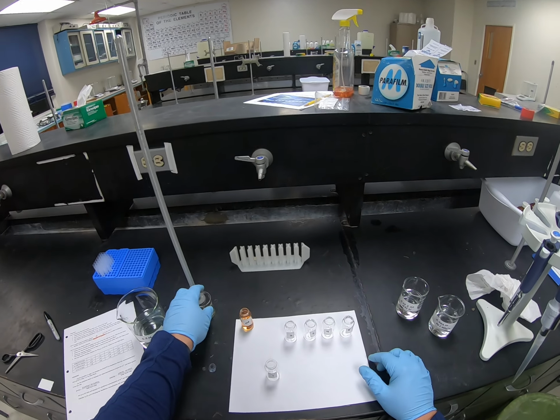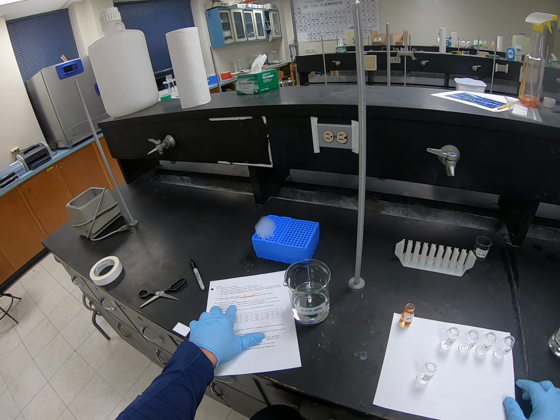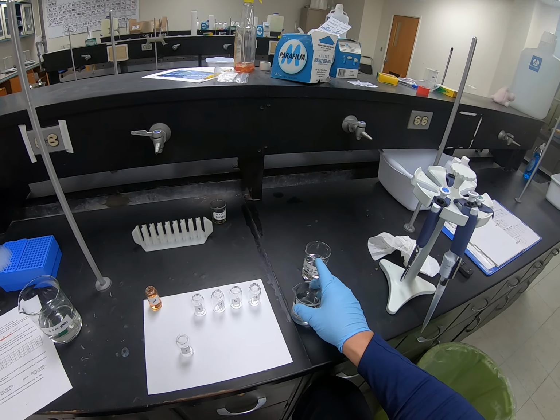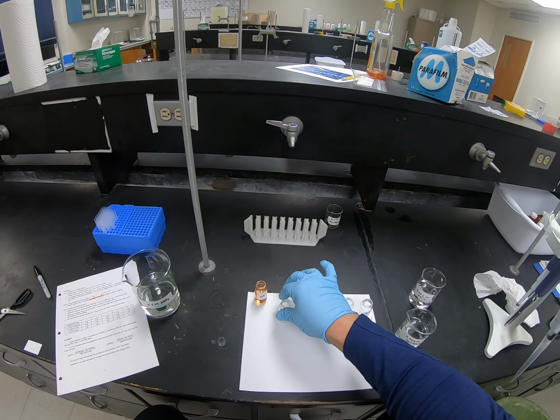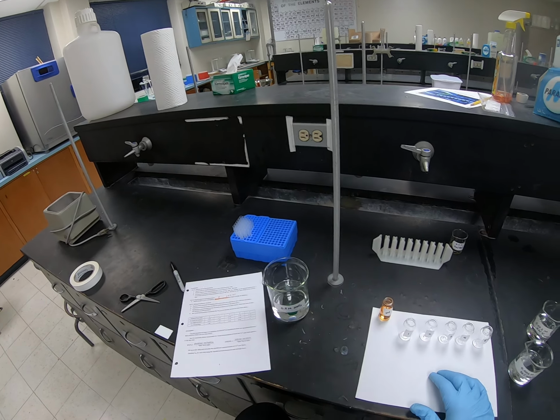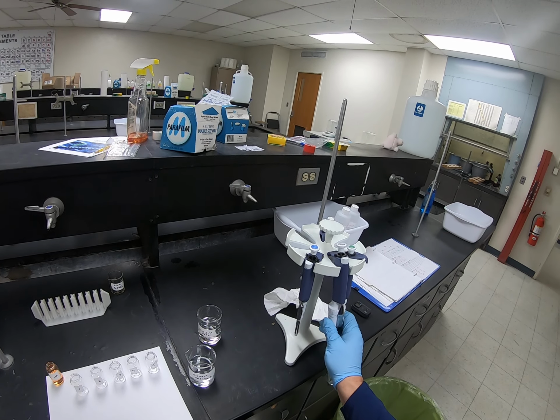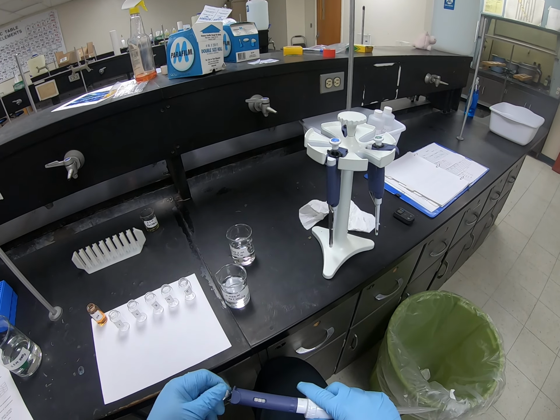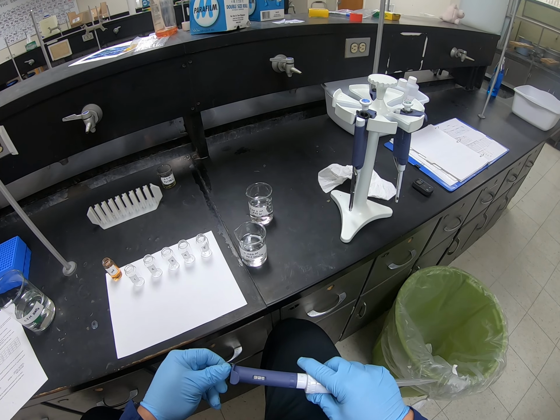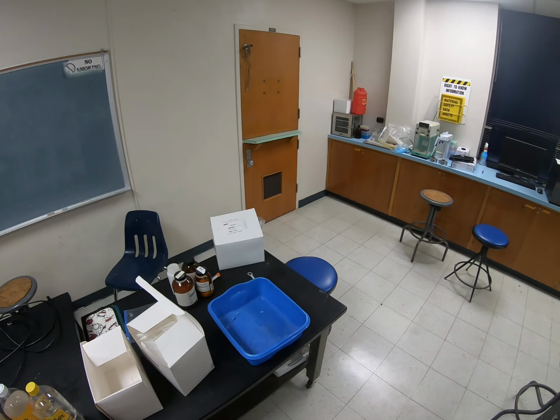Now I don't need to use this 0.2 molar iron nitrate, so I'm going to put it out of the way. What I need is the 0.002 molar iron nitrate, so this is the one I want to bring forward. And I want to put the same volume in every one of the vials, so I need 2.5 milliliters in each. I really don't have a nice convenient way to deliver 2.5 milliliters, so I'm going to use my large pipette and dial it in to 2.5. I think somewhere in the Gen Chem lab we have some that are 5 mils, but I don't have any of those available.